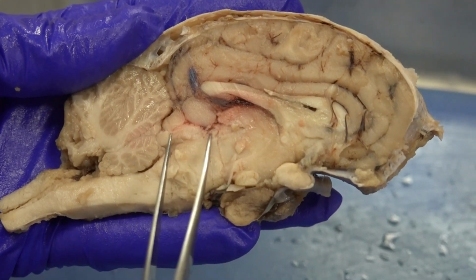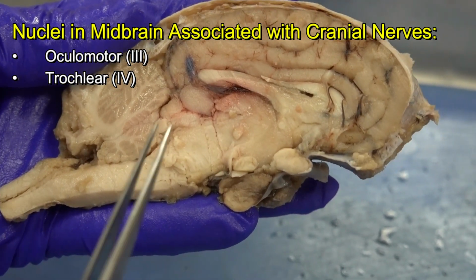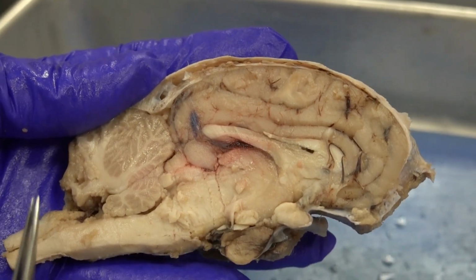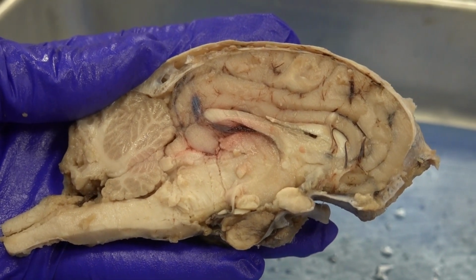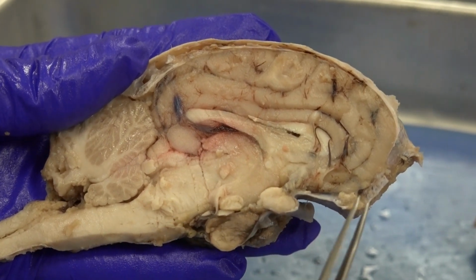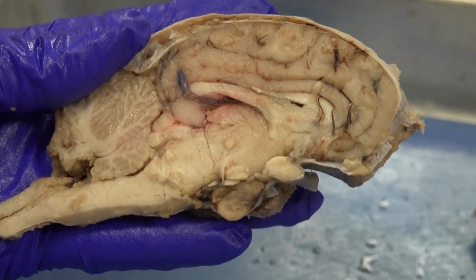When we get to the midbrain, we see that the nuclei that are associated with cranial nerves number 3 and 4 are located here. Number 3 would be oculomotor nerves, and number 4 would be trochlear nerves. So that kind of gives us an idea where we look for the origin of those cranial nerves. And recall that we have also the optic nerve that originates from the retina of the eye, and we also have the olfactory nerve that originates inside the nasal cavities in the olfactory epithelium.